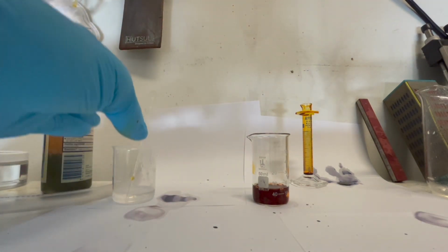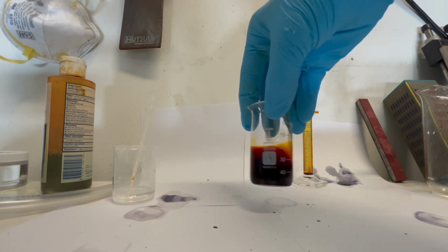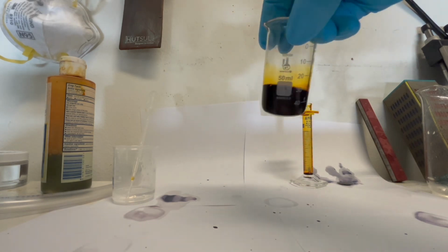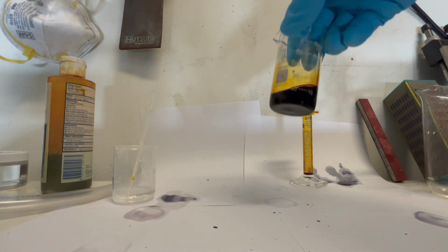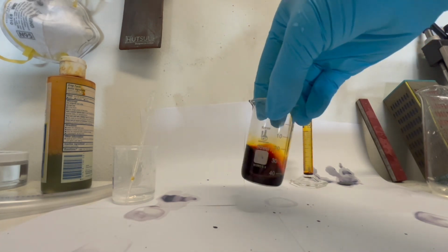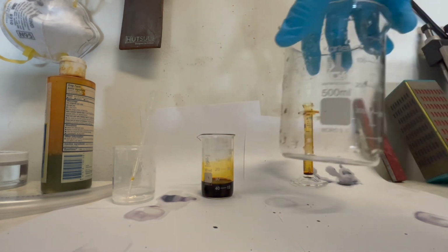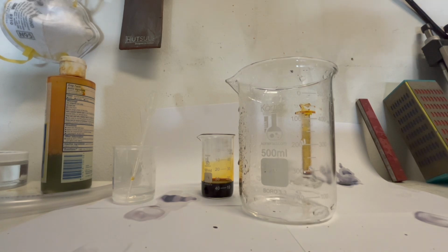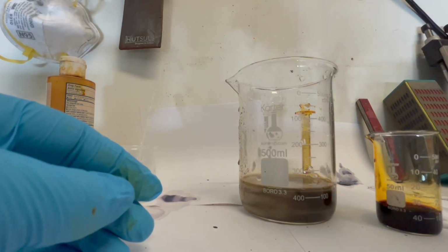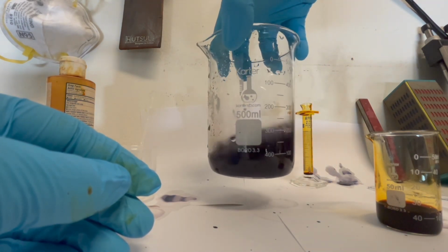You can see as soon as I squirt in the 1 milliliter of hydrochloric acid, all of the iodate and iodide ions are converted into molecular iodine. However, there are still some residual iodide ions which complex with the molecular iodine to form this extremely dark orange, red, or brown solution. It seems very similar to the povidone that we originally started with, and we're going to test it again in a large beaker with some starch. As you can see, adding just a little bit, the starch immediately complexes with the triiodide solution, forming this black liquid.